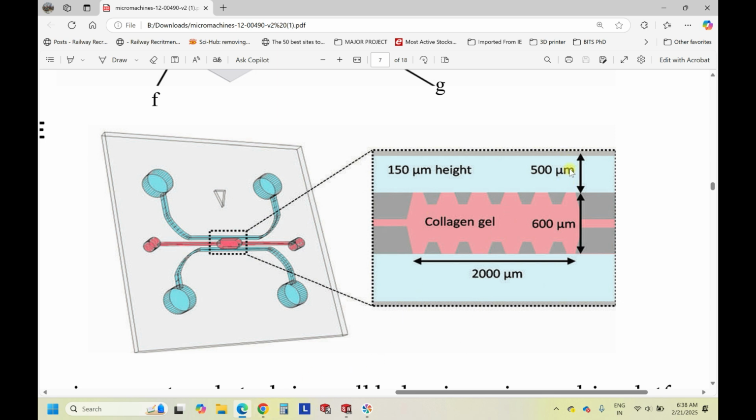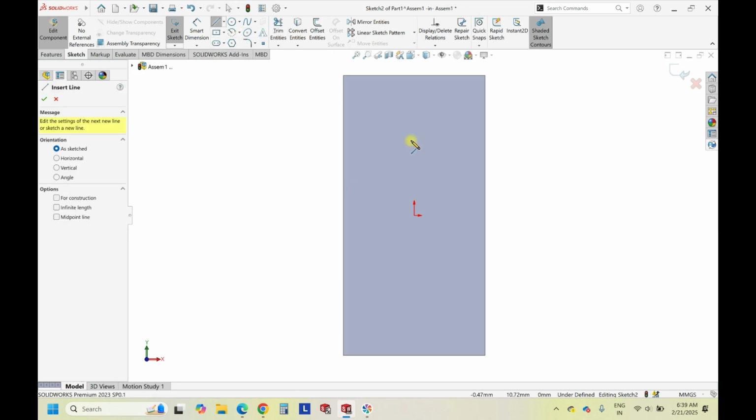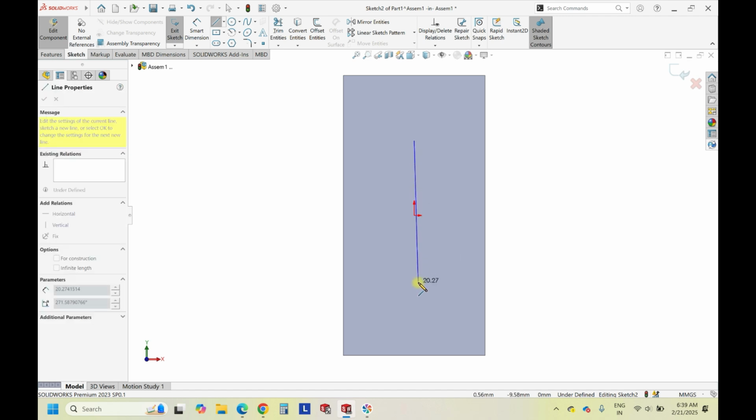So the dimensions are 500 microns for the channels, which are the cell culture media channels, and 600 microns for this. And it has a length of 2 mm. So I just take this, I don't use these dimensions at all because, to maintain the integrity, I'll use new dimensions. So let's aim to do initially with the middle or the groove area.